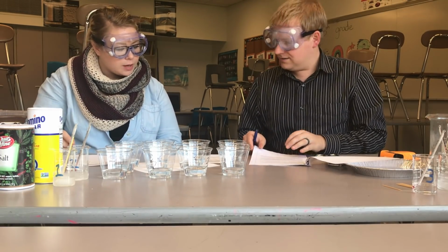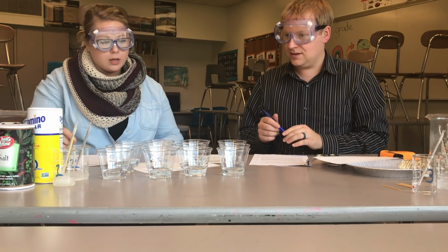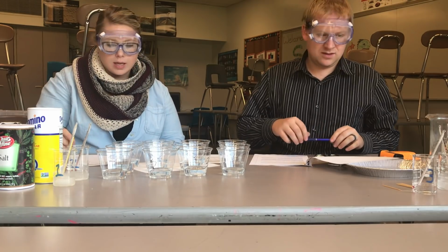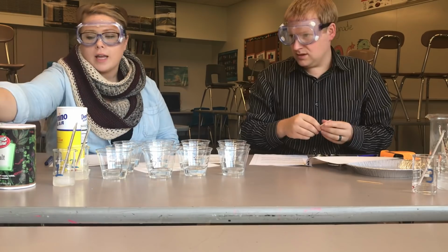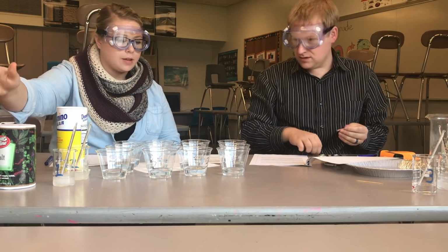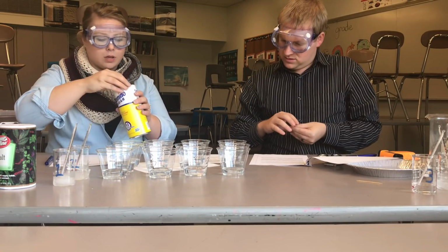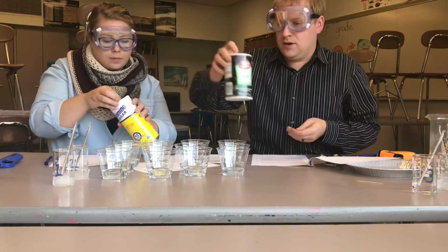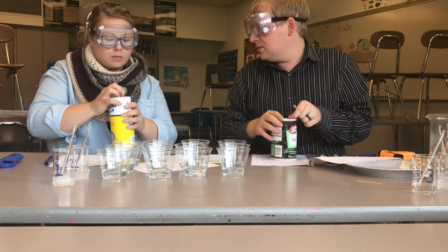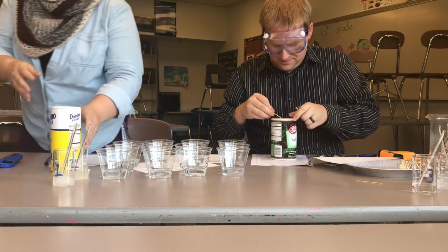Then the next property I think we can look at is solubility. And so we're going to look to see how well sugar, salt, and corn oil dissolve in these different liquids. So first let's look at how sugar dissolves in these 4 different liquids. Do you want me to move the camera so it can be kind of above? Because I don't know how well it'll see here.